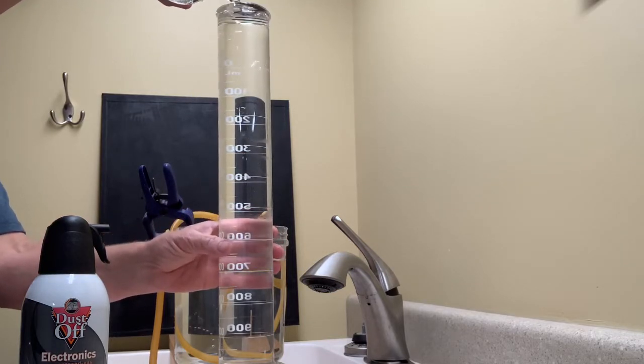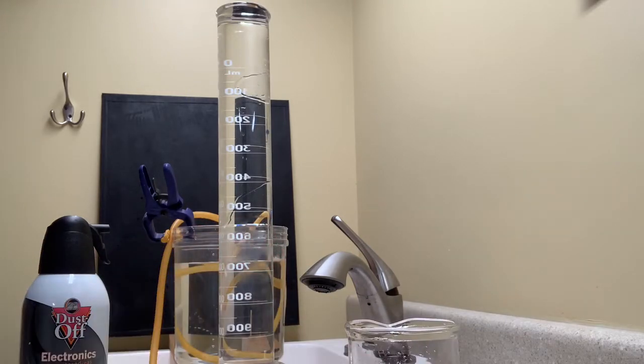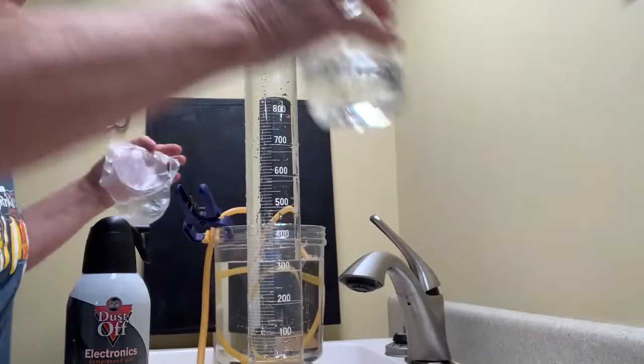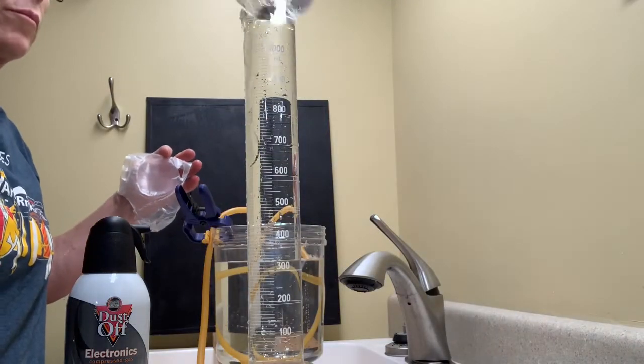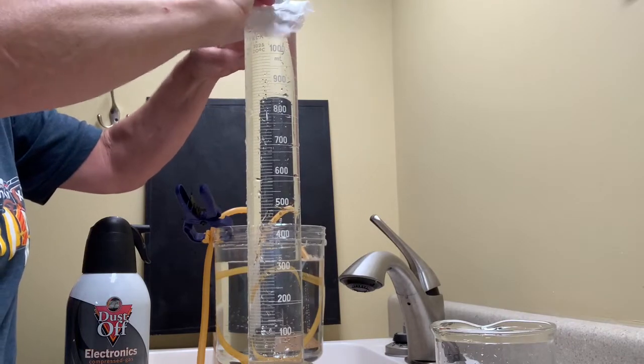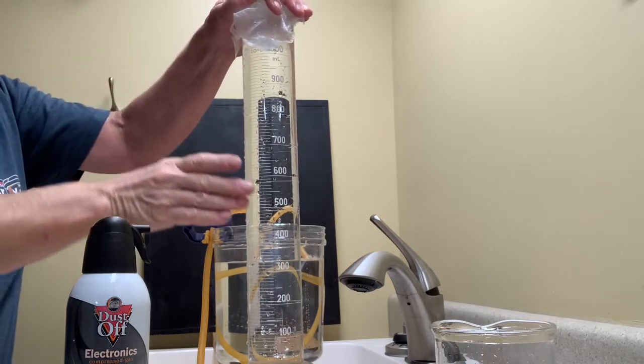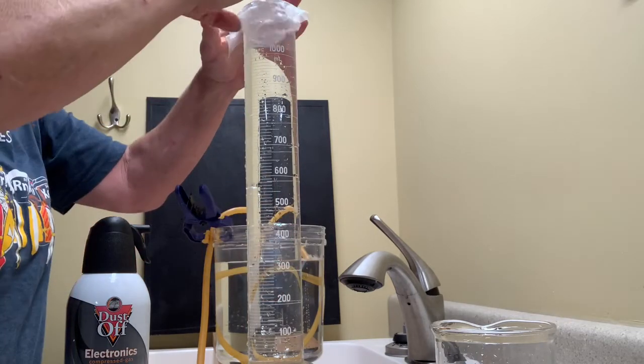And thus I will be doing the experiment over the sink, since the collection jug that the cylinder is turned upside down in will overflow. Also a little more challenging to try to not lose any water and introduce any air bubbles as the cylinder is inverted.